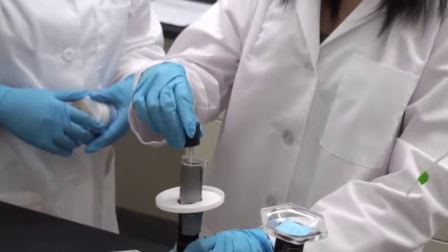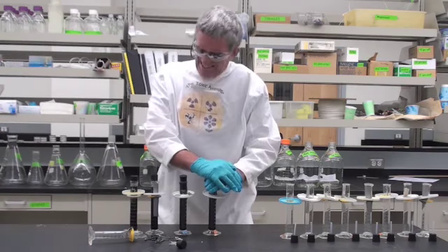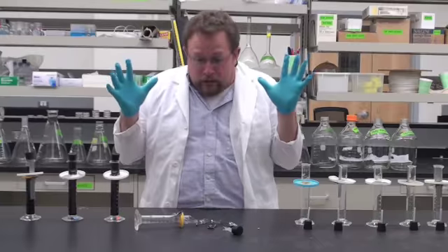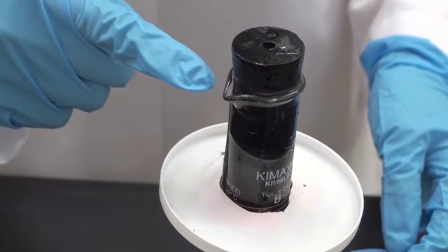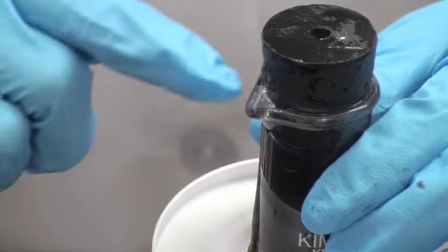Securely place the stopper into the graduated cylinder. Careful when inserting the stopper. If you accidentally cover the hole, the microcosm may become pressurized and biomass may squirt out, or your glass cylinder may break. It is very important that biosolids do not leak out the lip of the graduated cylinder. If you are concerned that there might not be an airtight seal, you may place a small amount of vacuum grease into the lip to prevent leakage.